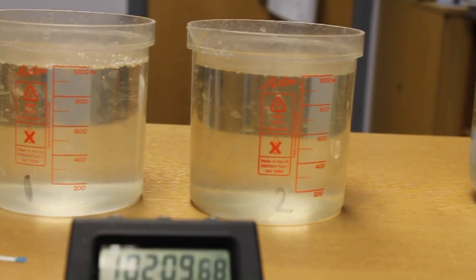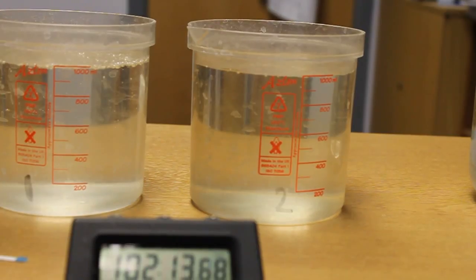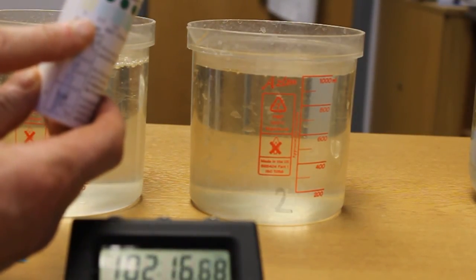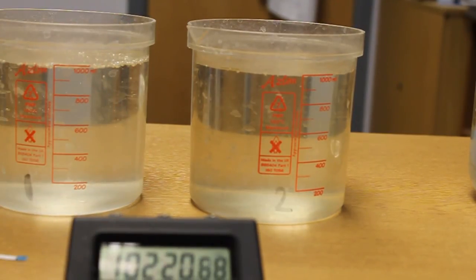So long as you have a dose of 0.3 in the water after one hour, you know that the dose is high enough. Thank you.